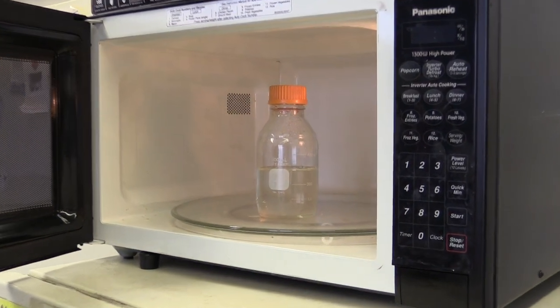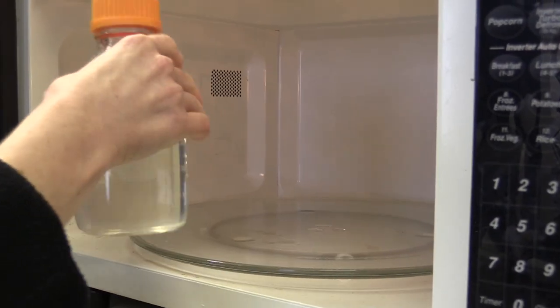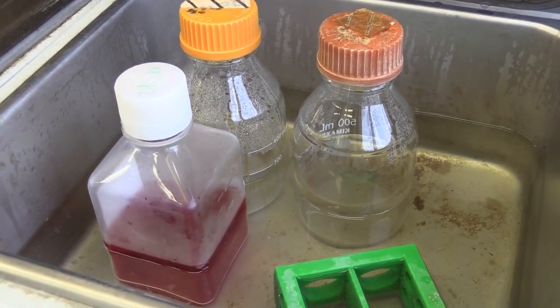For a plaque assay, we also add agar to the cell culture medium. At room temperature, agar is solid, so we put our agar stock in a microwave to melt it, and then we put the bottle of melted agar in a 45 degrees Celsius water bath, at which temperature the agar remains liquid but it's not too hot so that it won't damage cells when we add it to them.